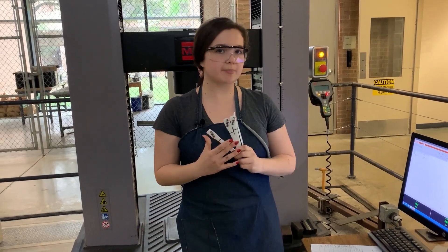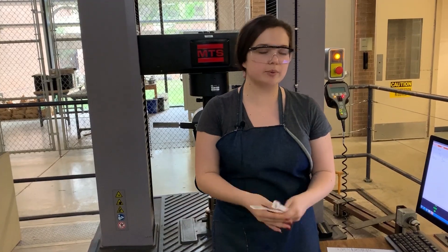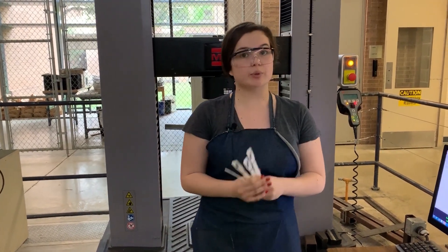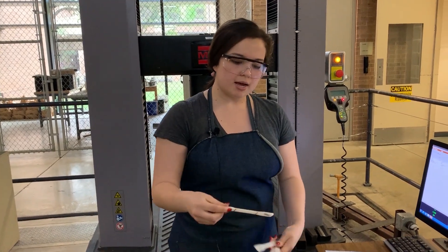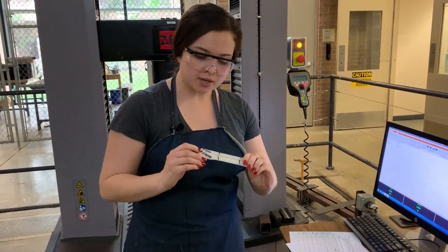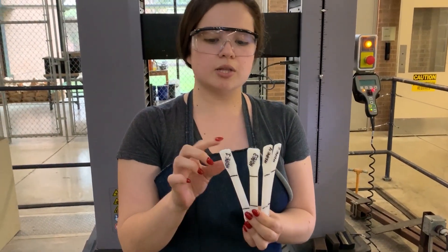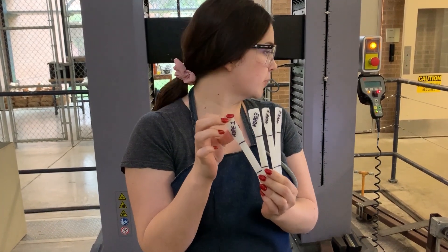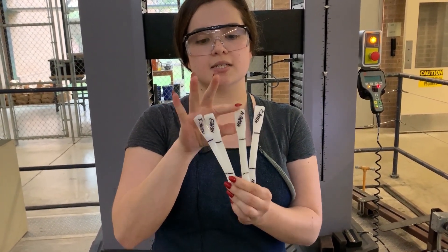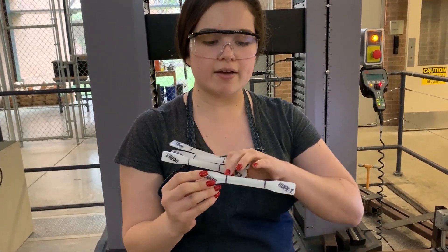We're going to be doing the rate dependence lab right now. We are going to be using the MTS, just like we did for the adhesives lab. Each of these specimens has different widths and thicknesses. We're going to be testing each one at a different rate: 0.2 inches per minute, 2 inches per minute, 20, and 40 inches per minute.